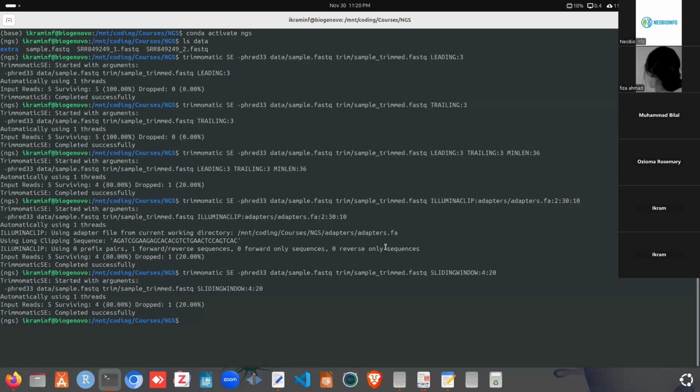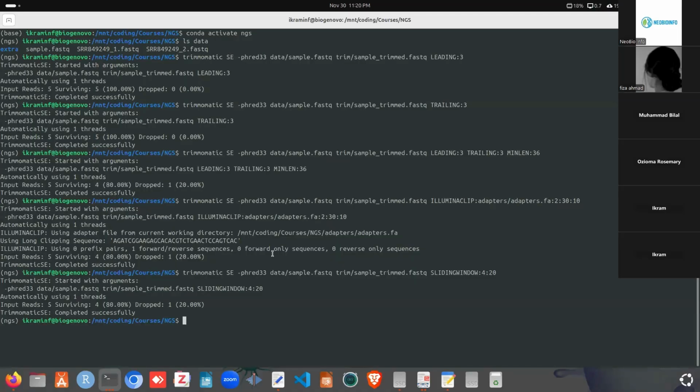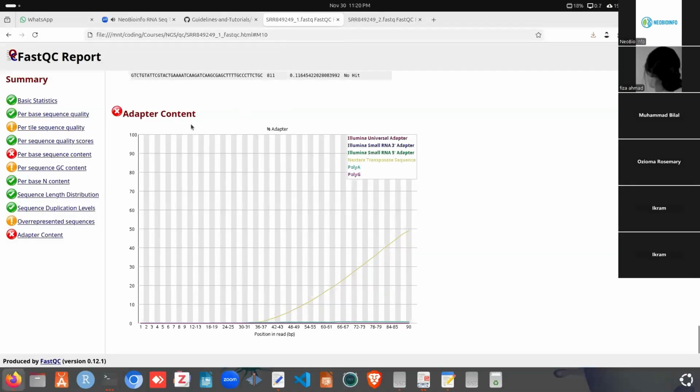Now if we run and check what we get, we can see we don't have this, we don't have it as we expected. So this is the way every parameter in the Trimmomatic tool works. This was for the sample FastQ file. Now we can proceed with our reads.